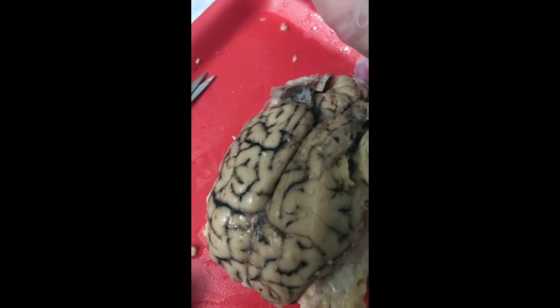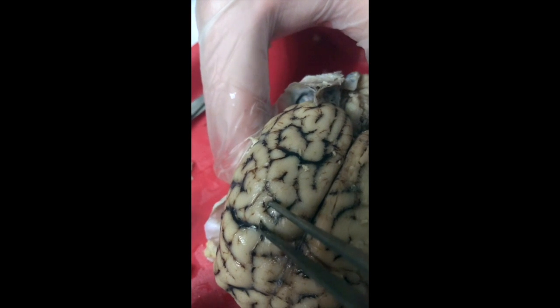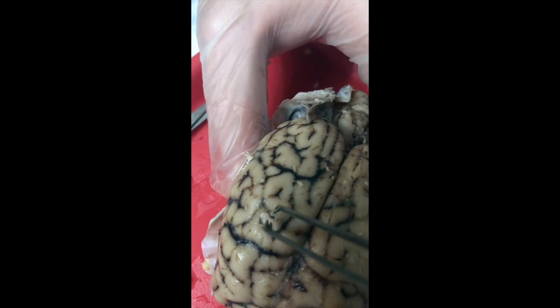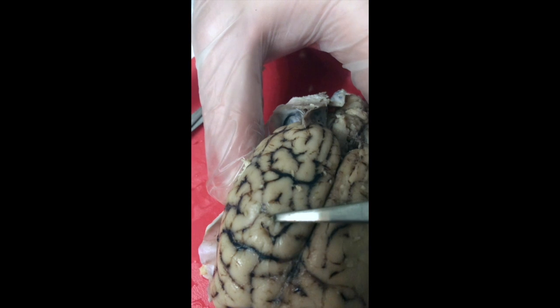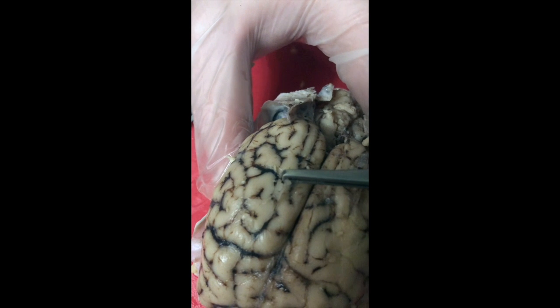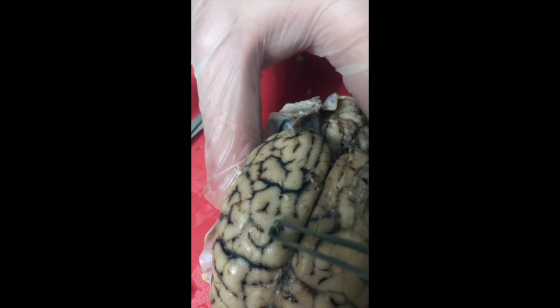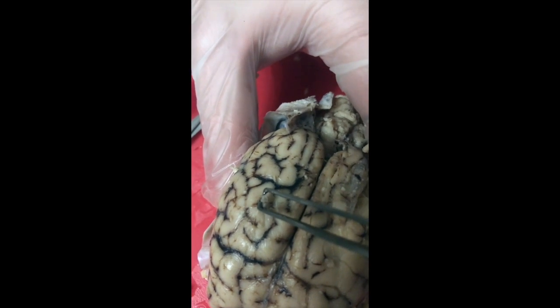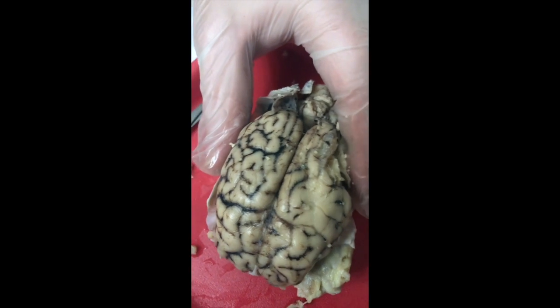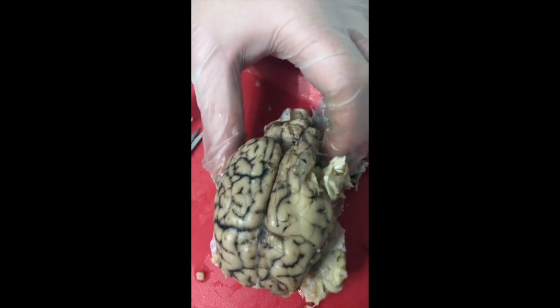All right, so now, if you look closely at the surface of the brain, you can see the shiny covering over the cerebral hemispheres, over the gyri. And if you pull on it with a pickup, it peels back, kind of like you're peeling a sunburn. But it doesn't come off in a nice big layer like the dura mater and arachnoid mater did. So there we get some of it. This that I'm pulling on right here is the pia mater, the innermost layer of the meninges. And you'll see that it was in direct contact with the cerebral cortex, not far enough away that we can actually separate the pia mater off the brain. So we're going to leave the pia mater in place.